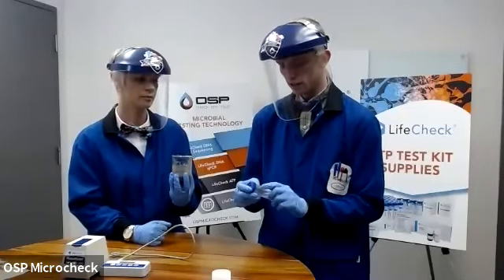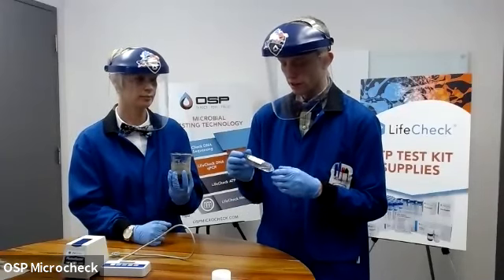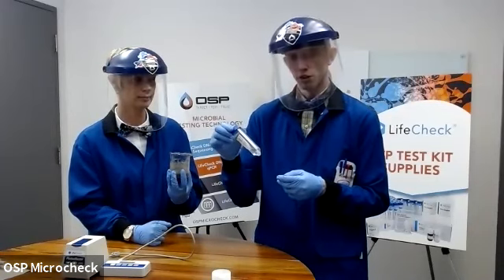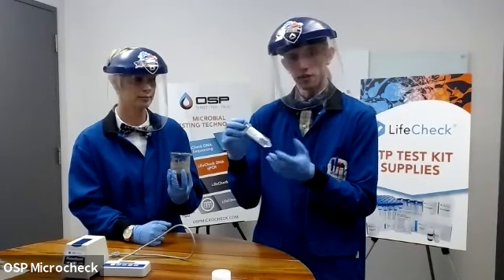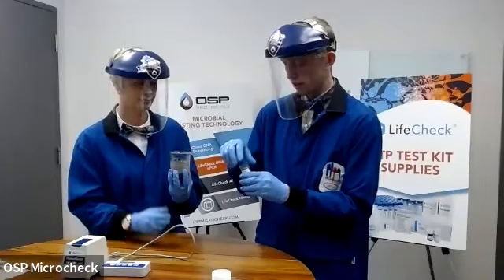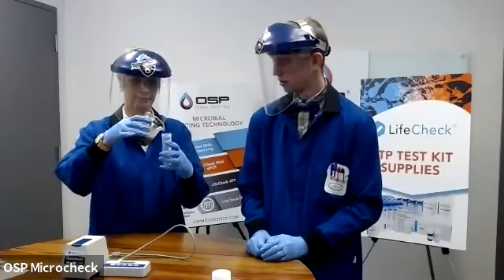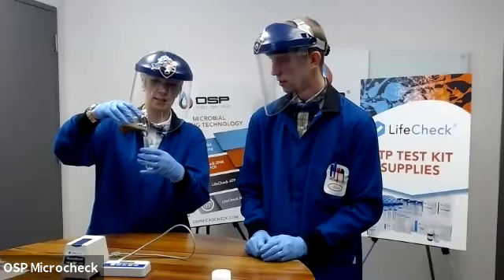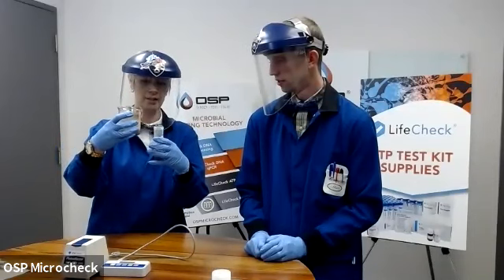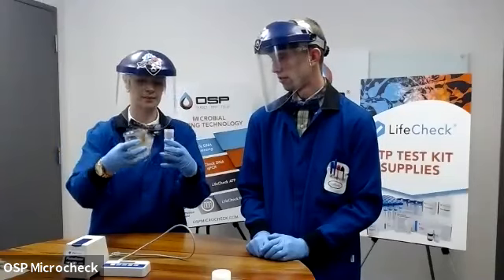So in the sessile soak method, there is no filtration step, of course, because that's what we're trying to avoid. So we go straight to the lysis step. And for that, we provide 50 ml Falcon tubes with 10 ml volumes of our lysis agent or reagent X. And what Virginia is going to do in this case is carefully pour some of her viscous sample into this tube. I don't know if you guys can see, but it is quite viscous. All right. And I'll put in a few more. 5 ml. 5 ml, perfect.